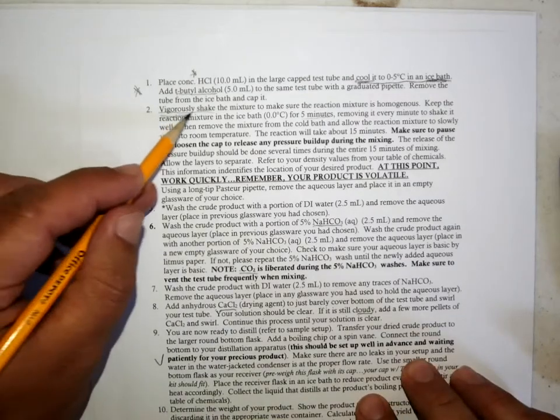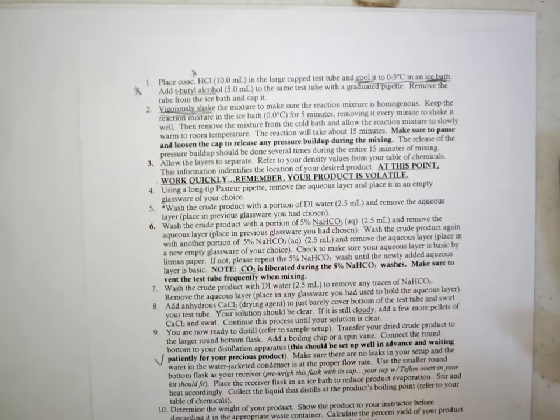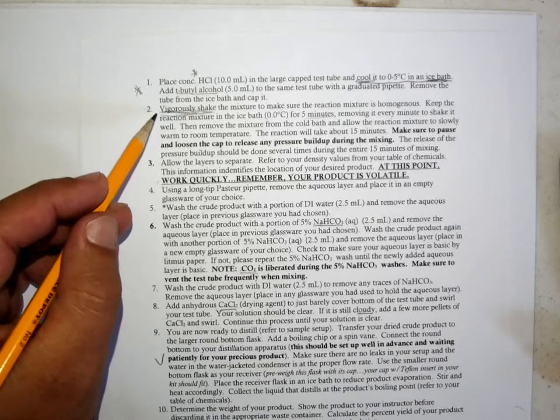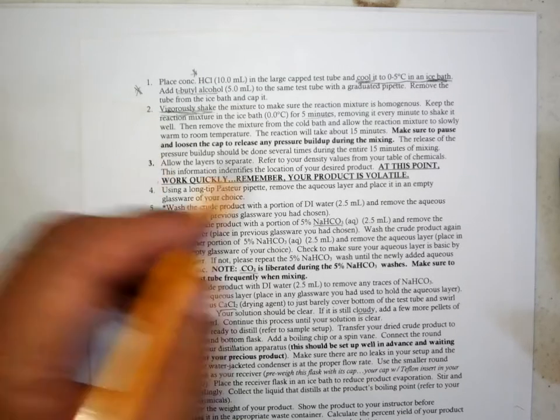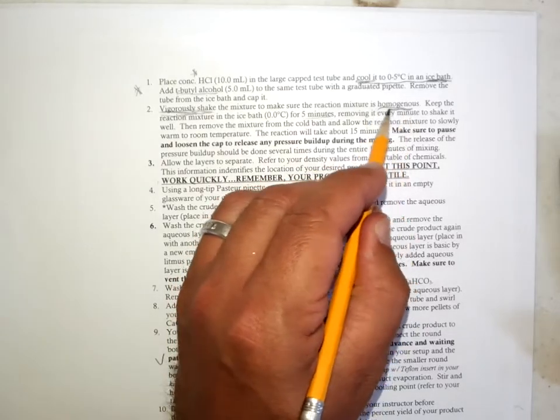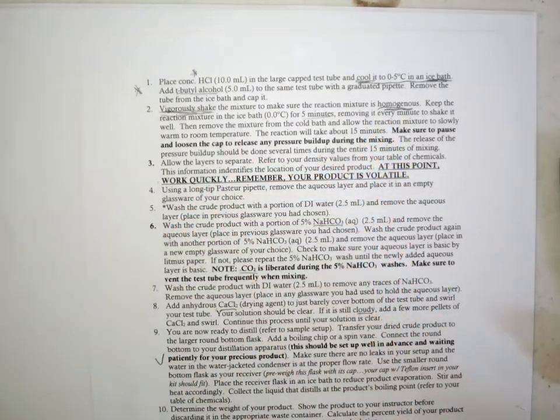If you watch the lecture video on the mechanism of this reaction, you'll see what we want to happen is the carbocation would be trapped by the chloride and not decomposed by deprotonation into the isobutylene. You've got to make sure this is vigorously shaken. Originally it said gently mix in the instructions, and that wasn't sufficient to affect a nice homogeneous solution. We need the reactants to get in contact with each other, and the hydrochloric acid has got to get to the alcohol to protonate it to form the carbocation.